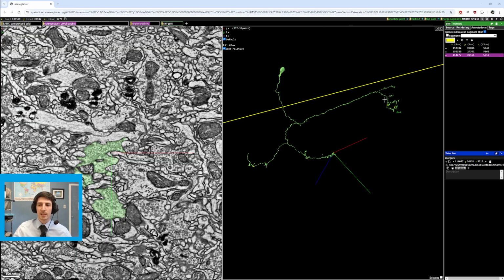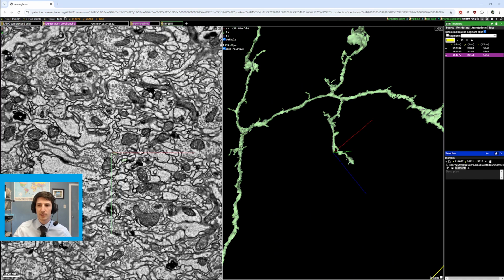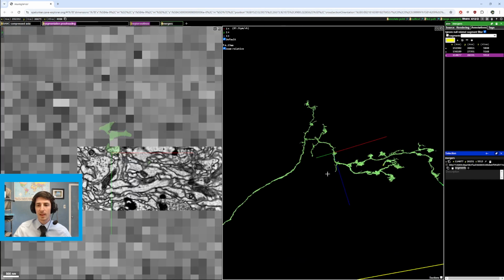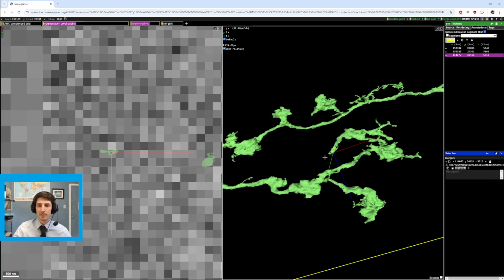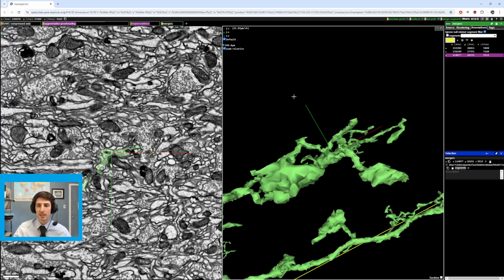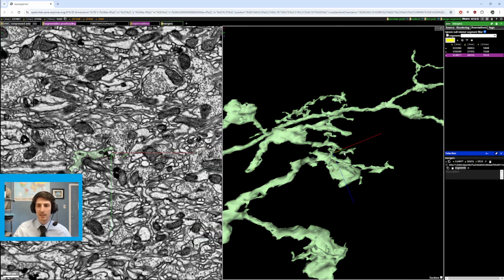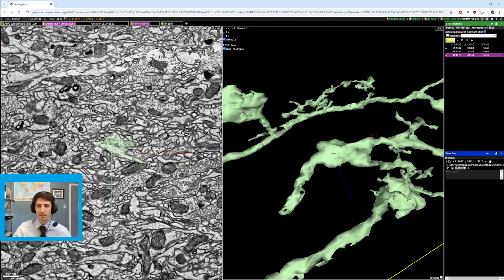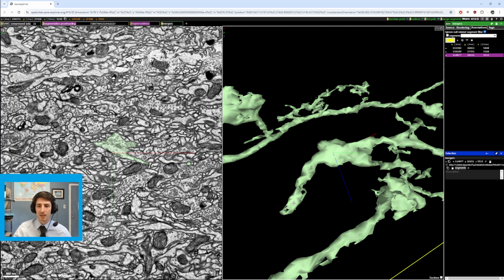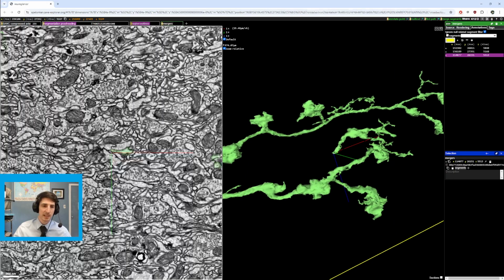Now we're going to check the opposite end of the cell. Probably get a continuation here. But one thing, so I found that one first, and then I found this one. So I was checking the tips here. This is a bit of a messy area, but again, this very thin connection to this much thicker branch, and then a bouton into a thin branch usually means that that's going to continue.